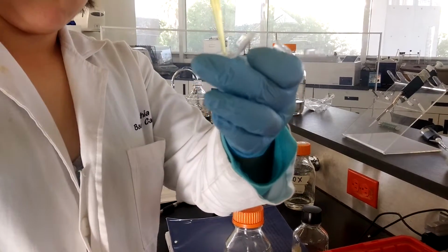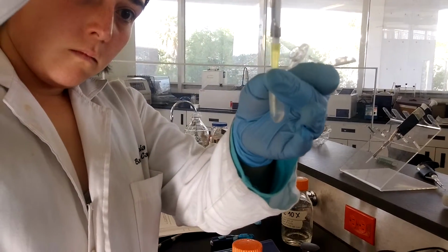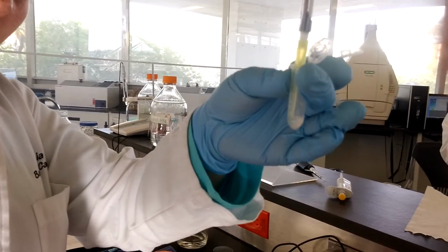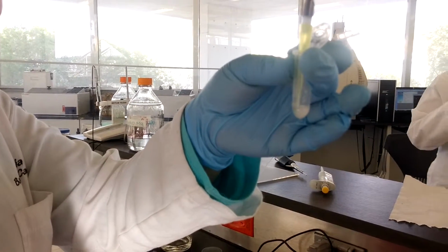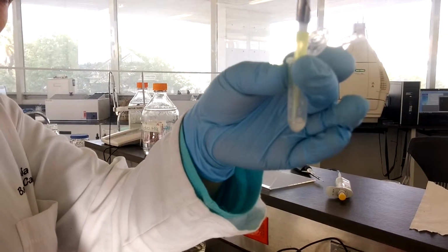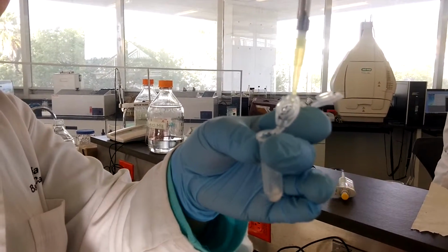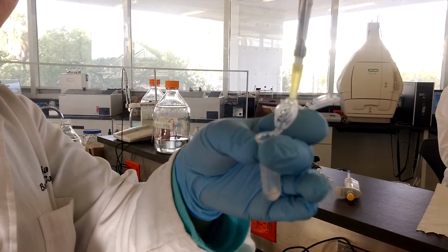By neutralizing the medium and adding a high concentration of salt, in this case potassium acetate, proteins precipitate, largely due to treatment with SDS and the high salt concentration. It also precipitates chromosomal DNA, probably because reassociation occurs randomly among different regions of the DNA and thus insoluble aggregates are formed. By contrast, plasmid DNA does not precipitate, remaining in the supernatant.